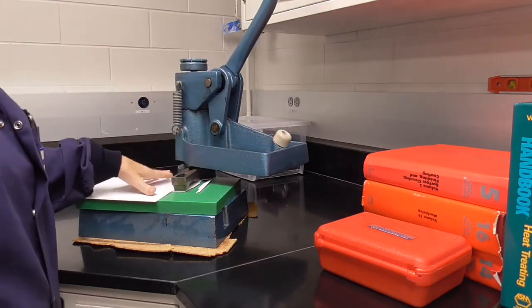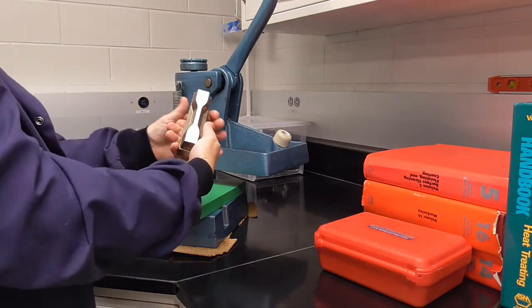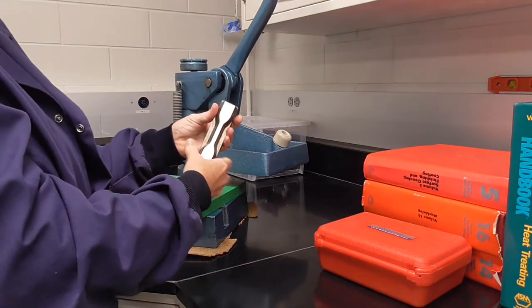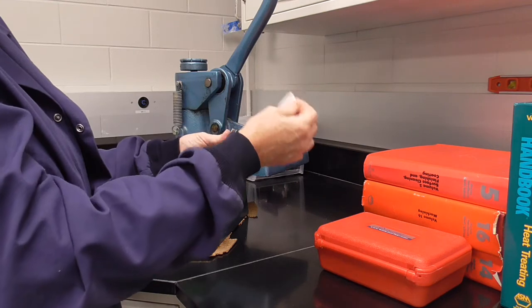Move the press out of the way and you have a dog bone cut from the film.